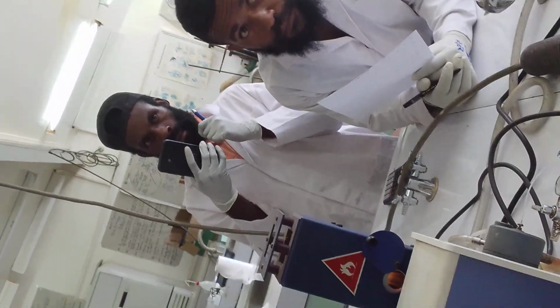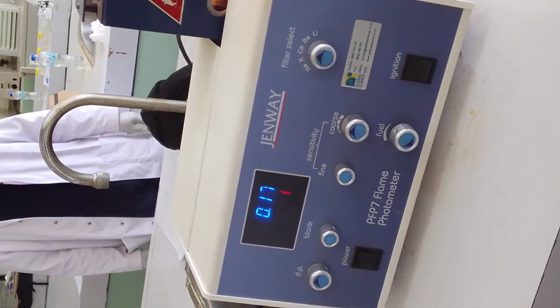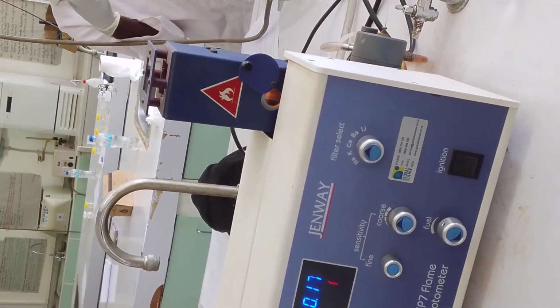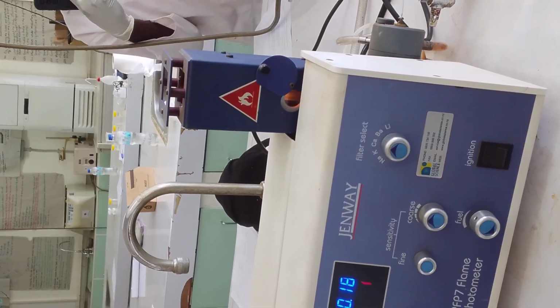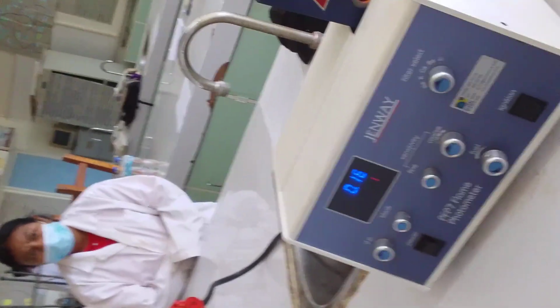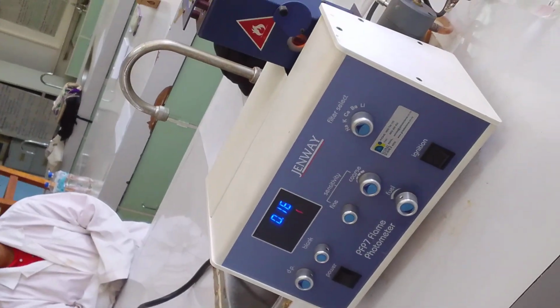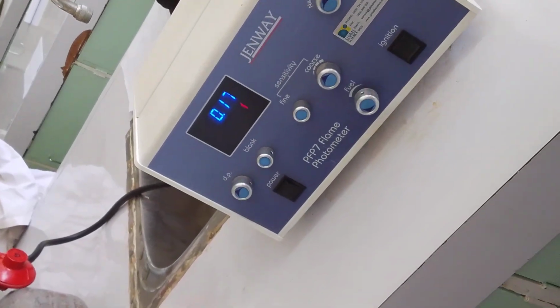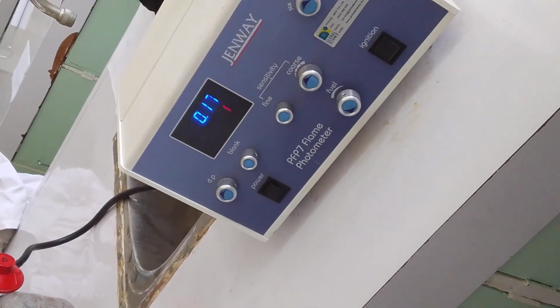Here, I just want to explain what blank is. If you are using a medium to make up your sample, that medium is your blank. Blank is not always distilled water, it's not always tap water, so you don't get mixed up. Blank is anything that you use to make your sample. When you bring it here, you use that medium as your blank. Dip this into the blank, then you zero this, and it will give you all zero.